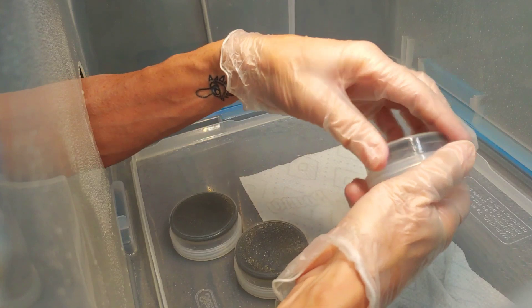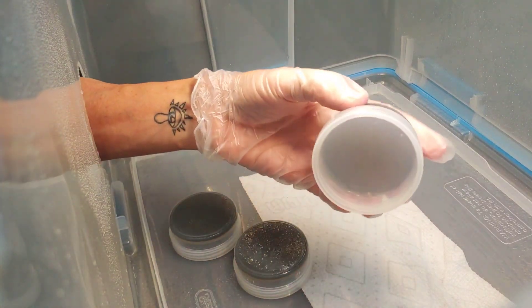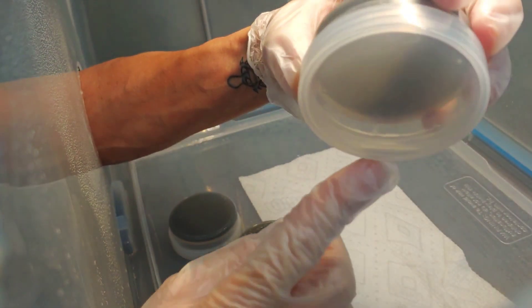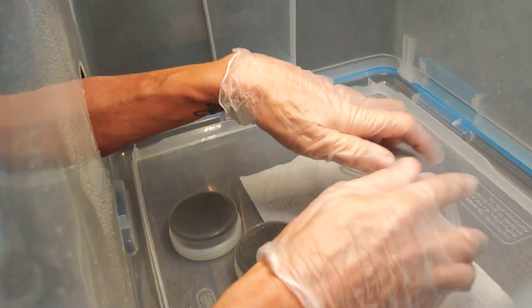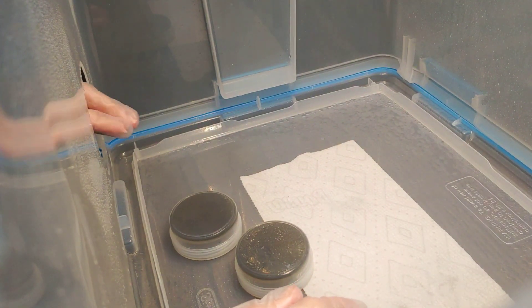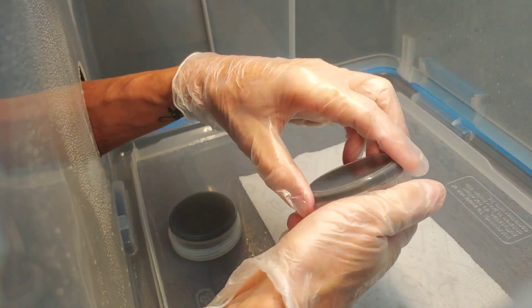Droplets at the top tend to stay there — that's okay. Tighten them up nice. I keep those in a separate group. This one's really nice, it has just a little bit of water. We'll see how the activated charcoal works out — it's supposed to help. I like the blue food coloring better visually, but I stopped using it altogether just in case — it's just another additive that could bring trouble. For videos I use blue because the mycelium shows way better when showing transfers and growth.